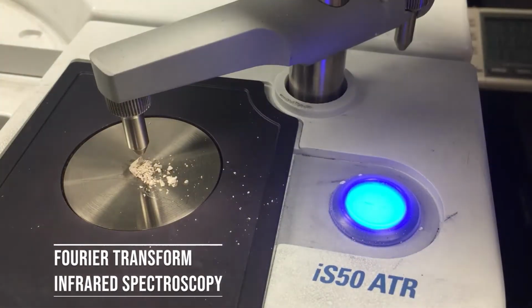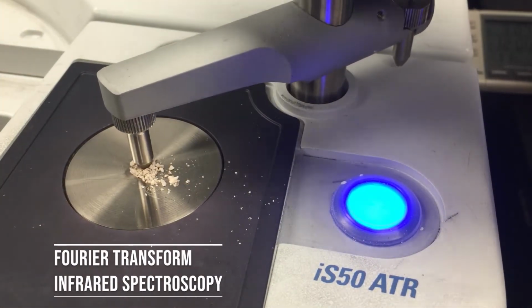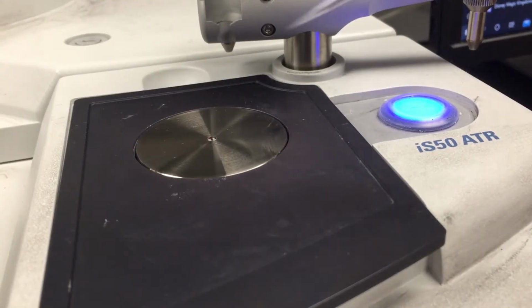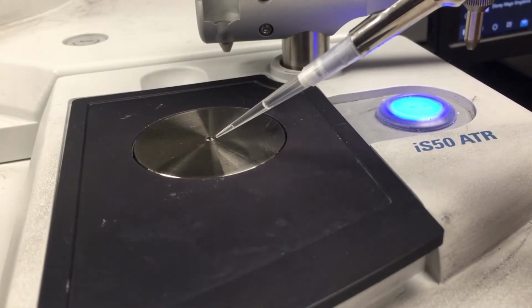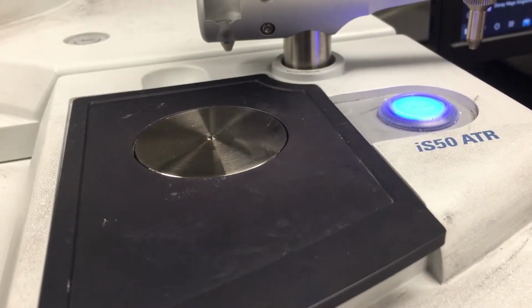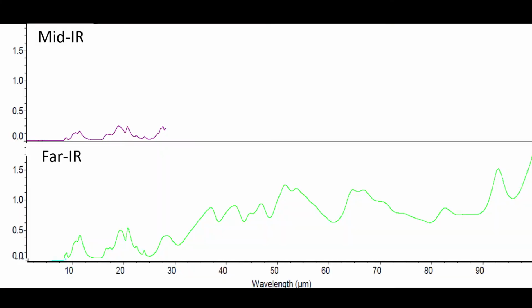There are two Fourier transform infrared spectroscopy systems. The IS50 has a diamond ATR crystal that can be used for solids, powders, and liquids with very little sample prep. It has both a mid-IR and far-IR beam splitter, allowing measurements from 1.5 microns all the way to 100 microns in wavelength.